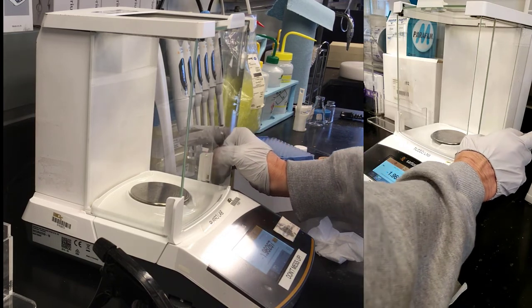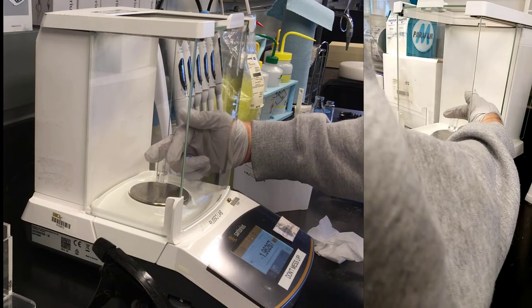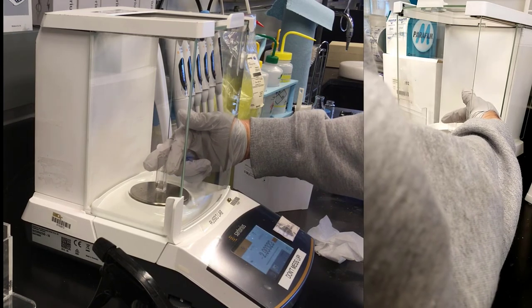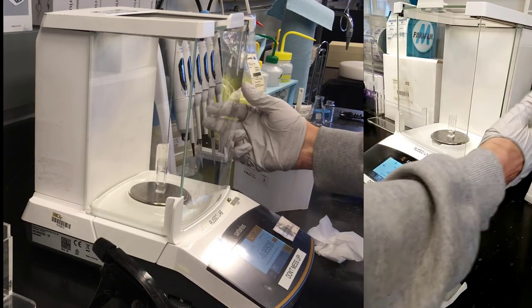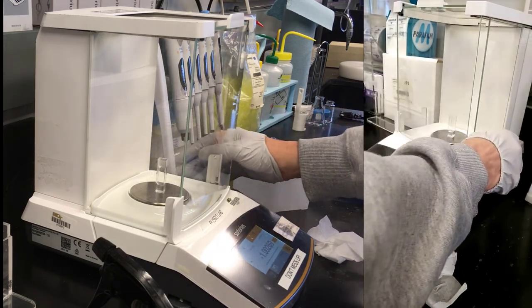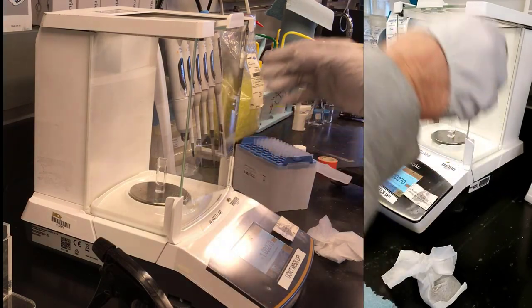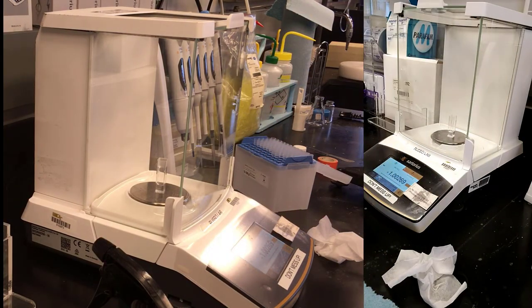Let's put it back. Notice that now it reads negative because I had tared it. Okay? And if I hadn't written down the amount of the actual cell before I tared it, I could be in trouble with this. Sometimes you really want to know the empty weight. So I always write the tare weight down. Let's give it a chance to come back.